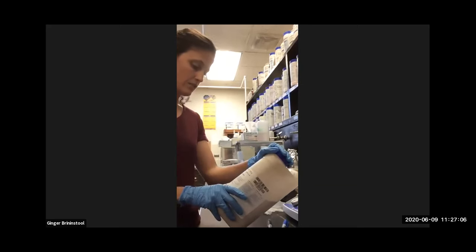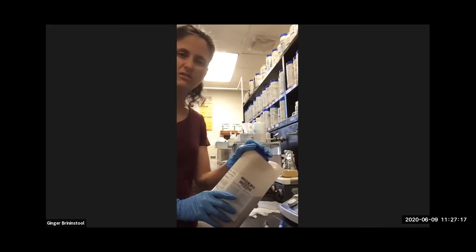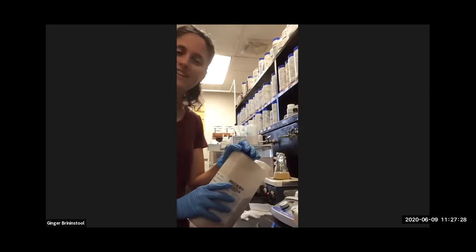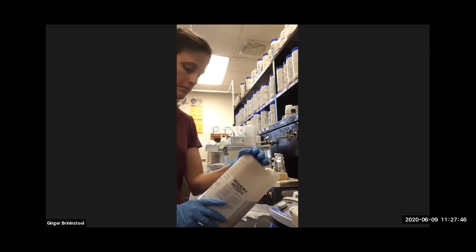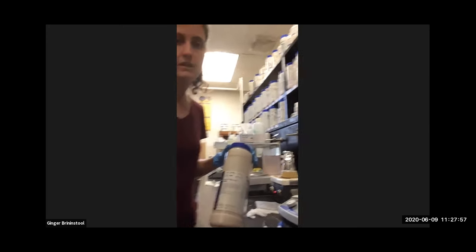It's got the exact same main ingredients, the beef extract and the peptone. You know, we all need food to grow, and microbes do too. And so beef extract, what is that? How do you get beef extract? I don't know, look that up. See what they do to make beef extract. Can't be pretty. But beef extract, I mean, it's as the name implies. This is not something very specific. It's just kind of an all-purpose general stuff. And peptone, well, that's just a big old collection of proteins. So it's just a mixture of good things that microbes can use. And so this is a pretty general growth medium. So nutrient agar and nutrient broth, those are all-purpose growth mediums.